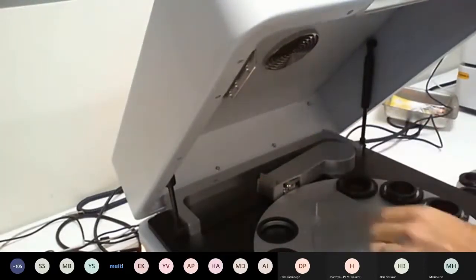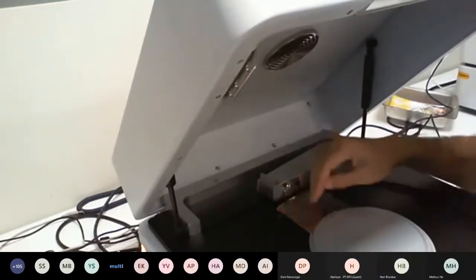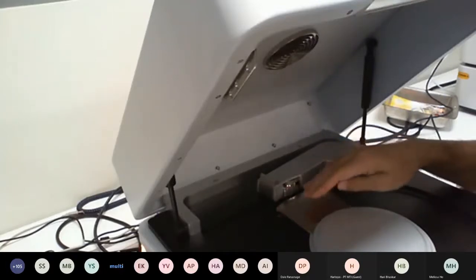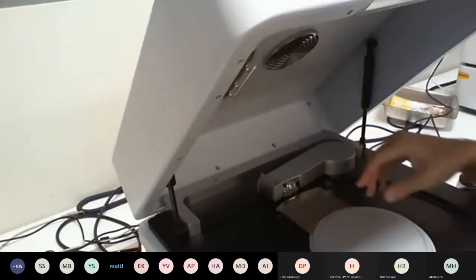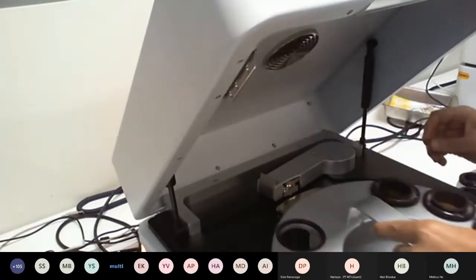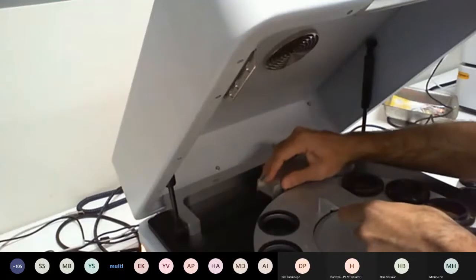Okay. So underneath our sample tray, we have a reference plate which contains a sample that is analysed routinely, which helps to account for the drift. It also protects the optics from any material that might fall into it when the instrument's not being operated. And it also stops anyone being able to access the optics and any damage there, so it assists in protecting it.